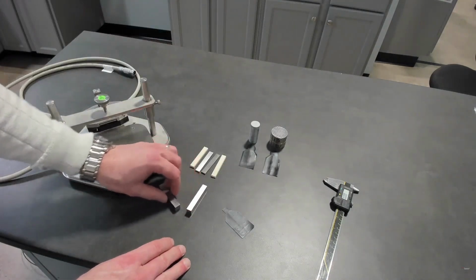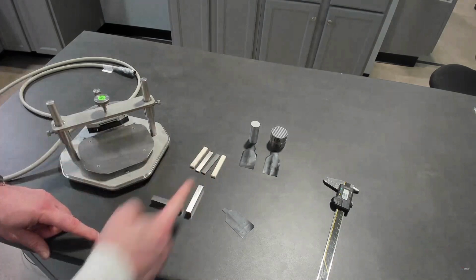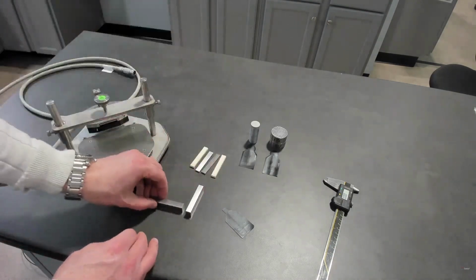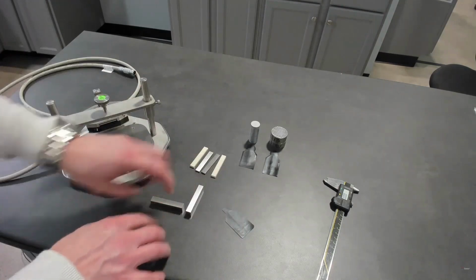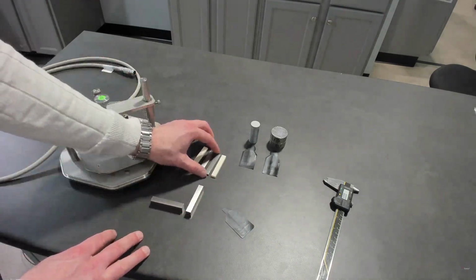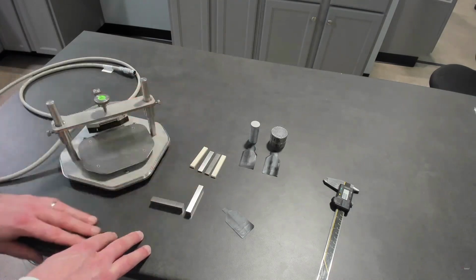Or if you want to look at that third direction, in this case you'd have anisotropic this direction and through thickness, and in this case anisotropic this direction and through thickness. You'd have all three dimensions on samples that you cut from a bigger sample. And then you can run slab, which gives us the same capability to isolate directions, but on thin materials.